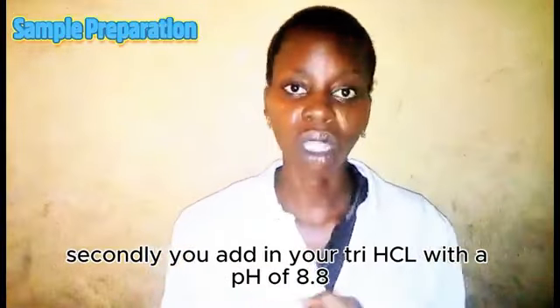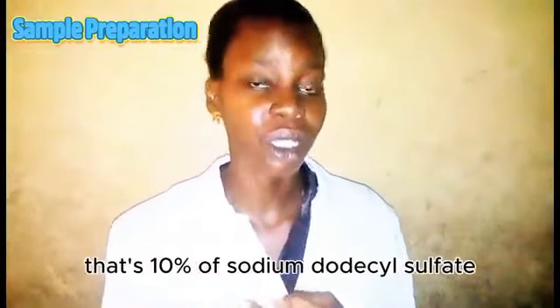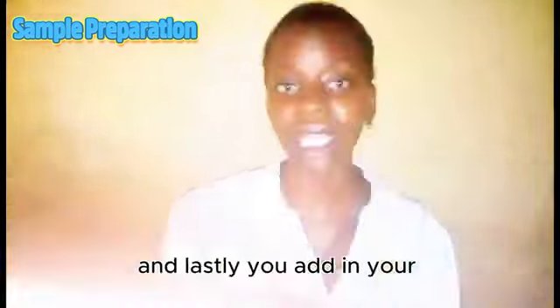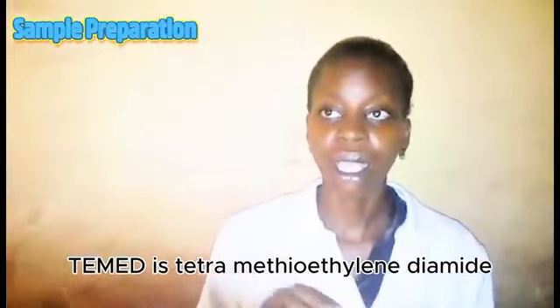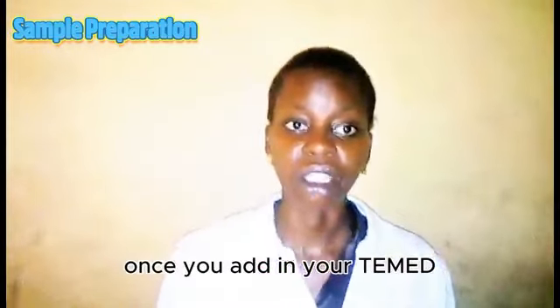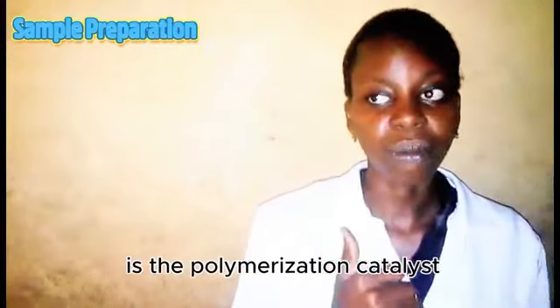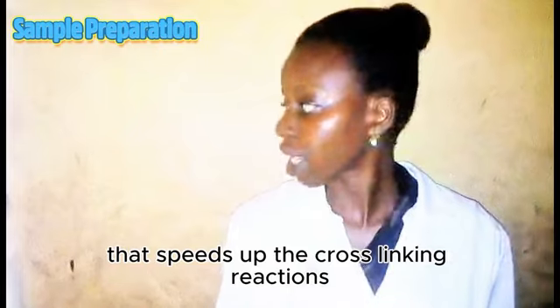Secondly, you add in your Tris-HCl with a pH of 8.8. Then you add 10% of SDS, that's 10% of sodium dodecyl sulfate. You also add in 10% of APS, that's 10% of ammonium persulfate, and lastly you add in your TEMED. This TEMED is tetramethylethylenediamine. Once you add in your TEMED, you mix gently but quickly and make sure it is used immediately. APS and TEMED are the polymerization catalysts that speed up the cross-linking reactions.